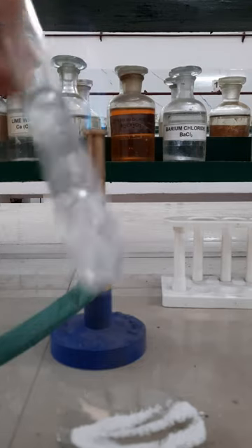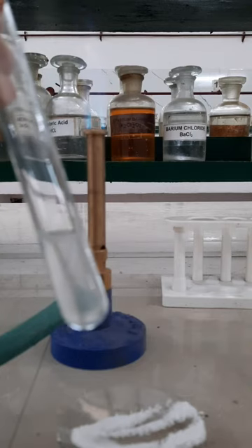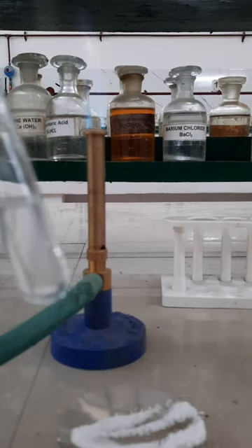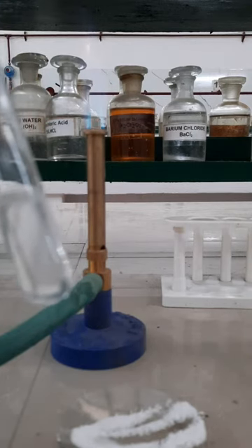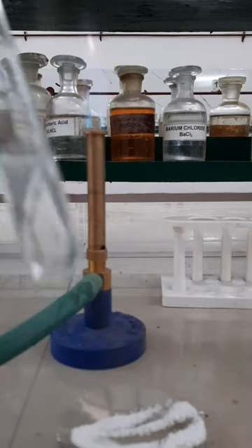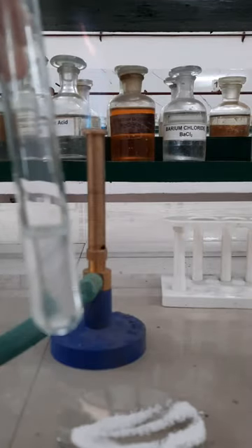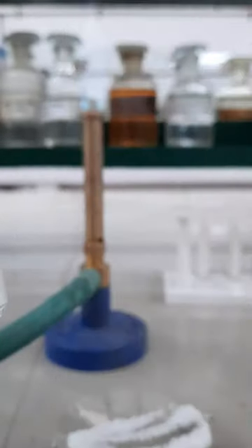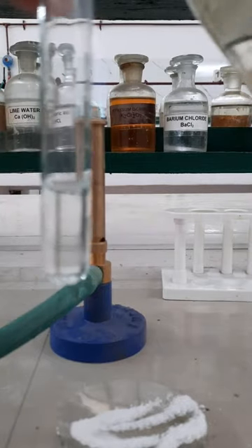Now cool the mixture and then add ammonium molybdate solution into it. Here is a bottle containing ammonium molybdate solution. I am adding ammonium molybdate solution into the test tube.